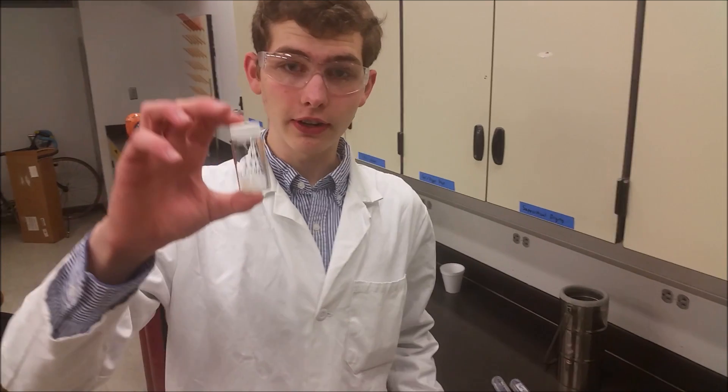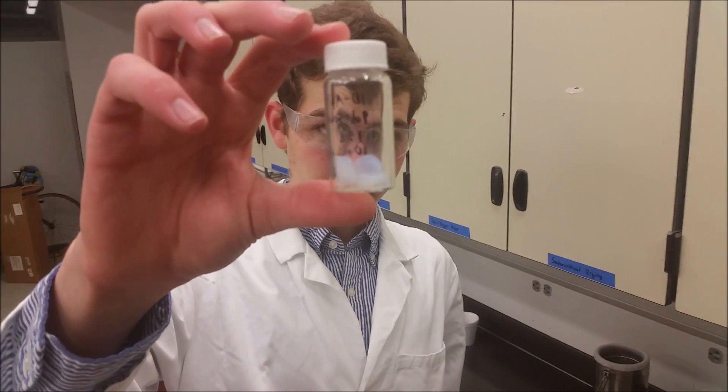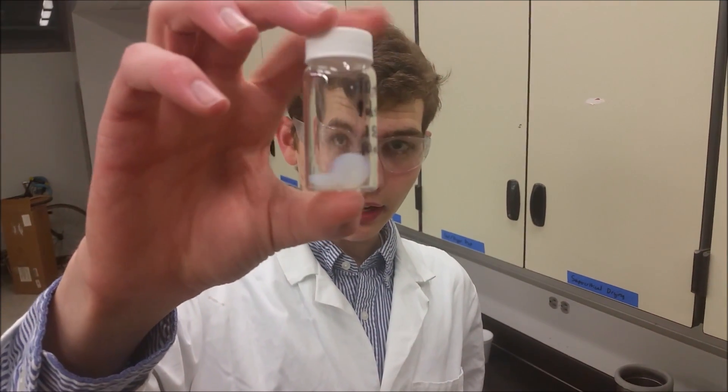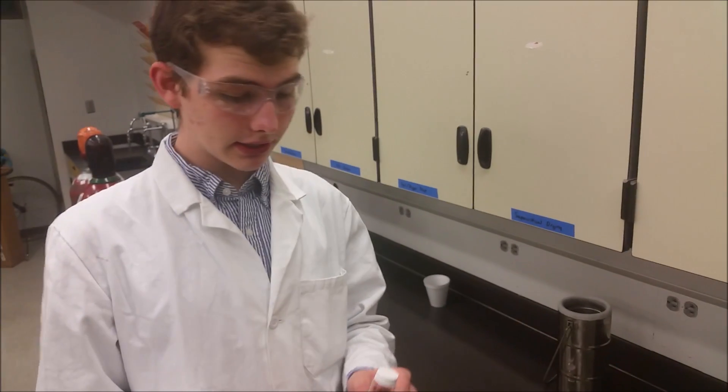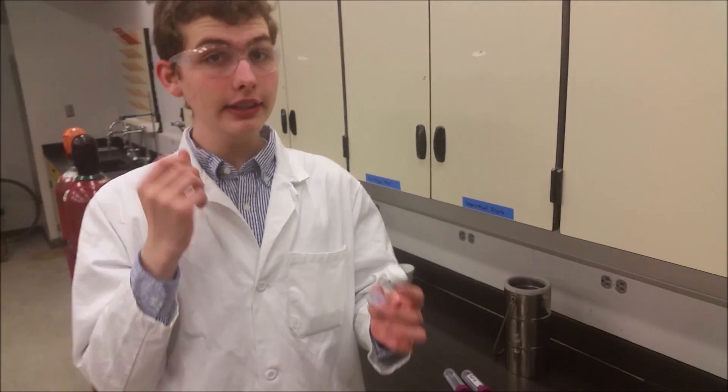This is a vial full of aerogel. You can see it's a very light blue, kind of hazy looking substance. It actually has the nickname frozen smoke and it's very, very light.